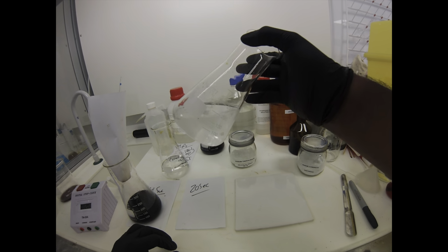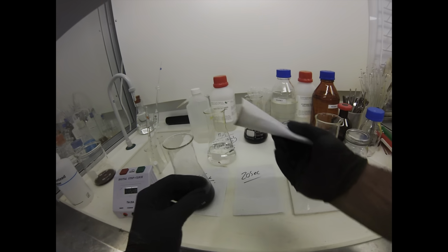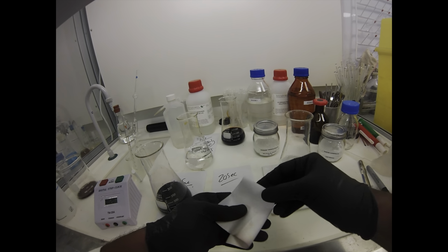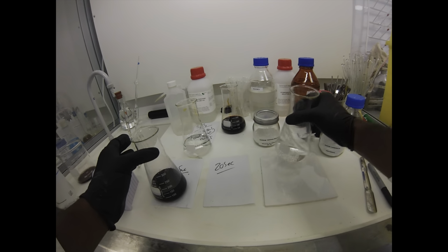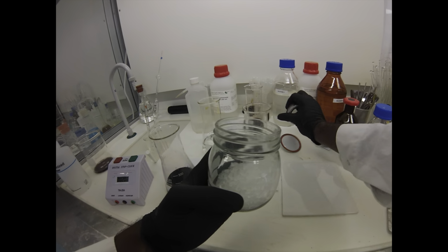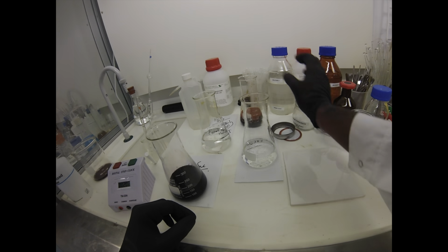What I've done on that flask on the left is I've put a little wad of paper just in the neck, so you can see that's being stained from the iodine fumes that are coming off. You can actually see the purple iodine gas coming off the solution where we've dissolved so much KI in there as well, so it's really important to do this in the fume hood. You find that with the spent solutions and with solutions that have been sitting there for about 24 hours, on the addition of thiosulfate, you'll get this fizzing.